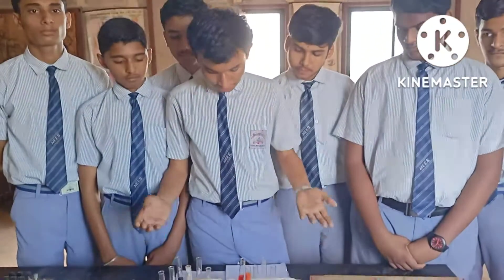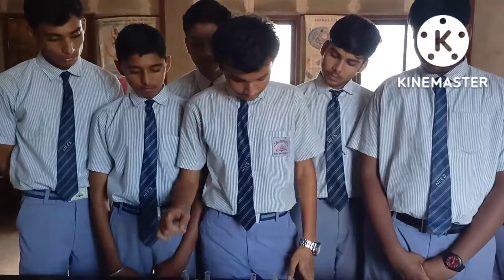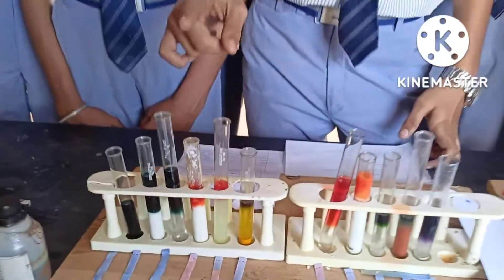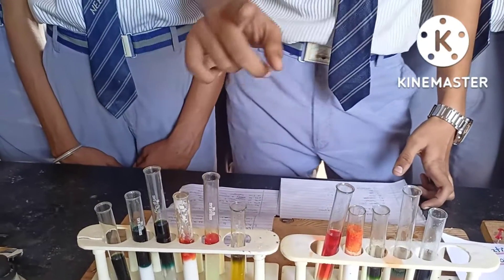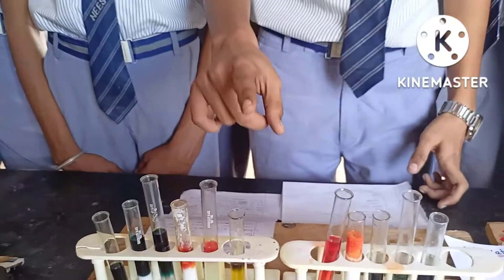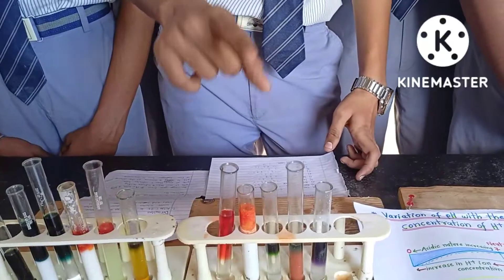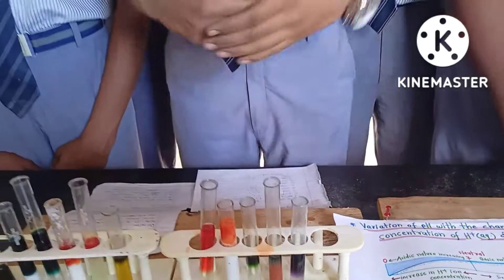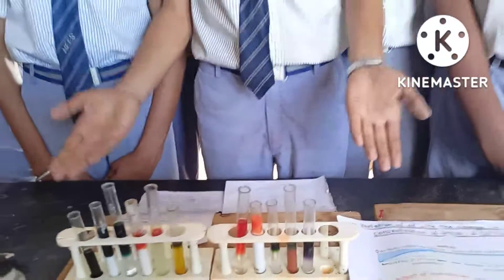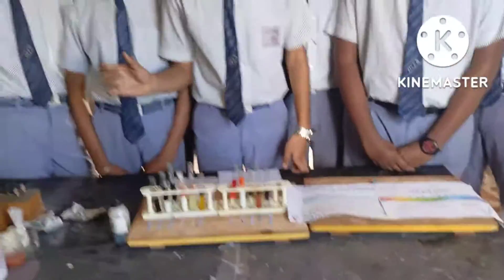We have a sample of tap water, then baking soda, after that distilled water, curd and lemon juice, then turmeric and then vinegar, lime and salt, soil and washing soda. We have formed these solutions by using distilled water.